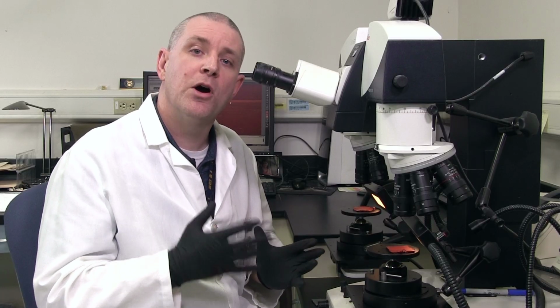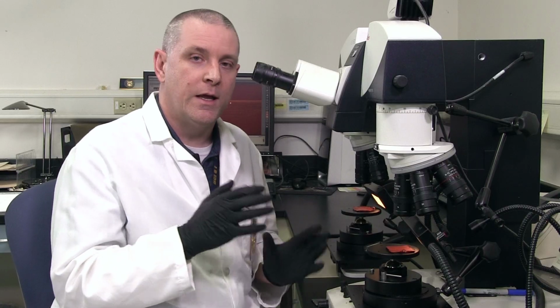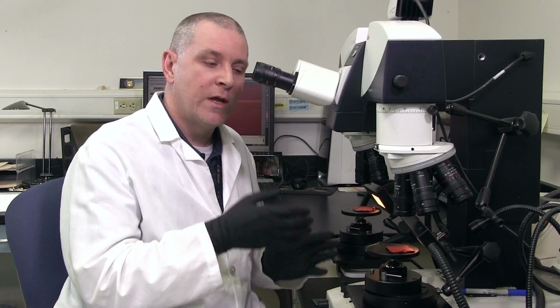And what we're looking for is a series of lines, the marks that are made when that tool scrapes across the metal. And this instrument that we use is called a comparison microscope. And the way it works is you've got one set of eyepieces that we look through, and we can look at two different objects side by side at the same time. So let's take a look.